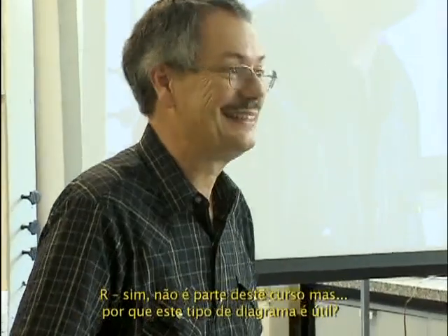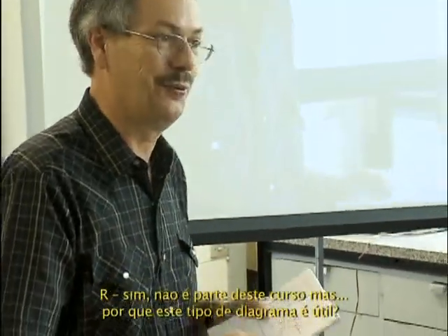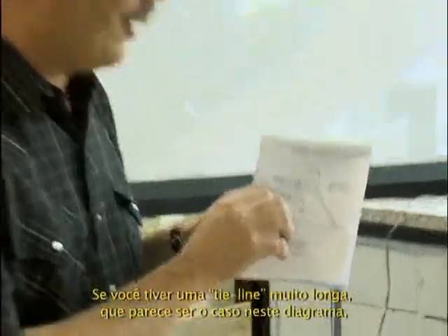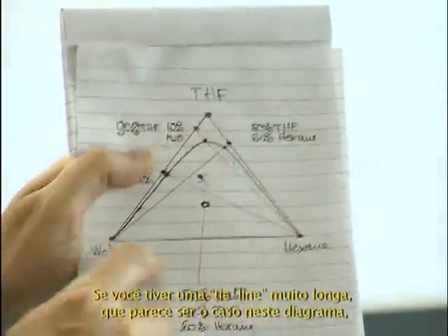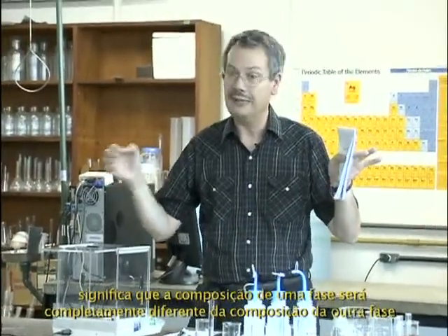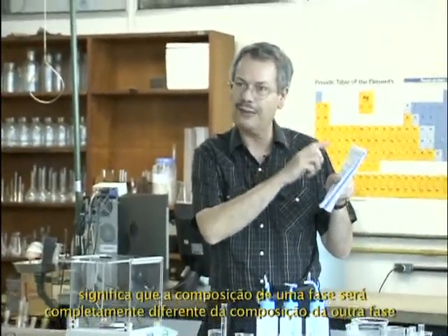Yeah, so this is not part of this course, but why is this kind of diagram useful? If you have a very long tie line, which seems to be the case in this diagram, it means the composition of one phase is completely different from the composition of the other phase.